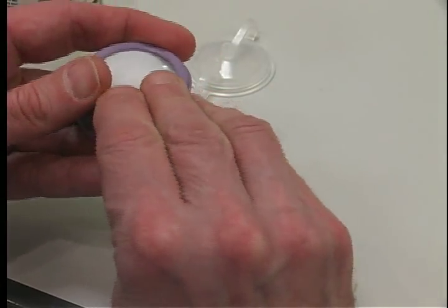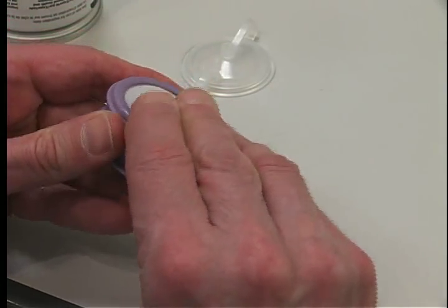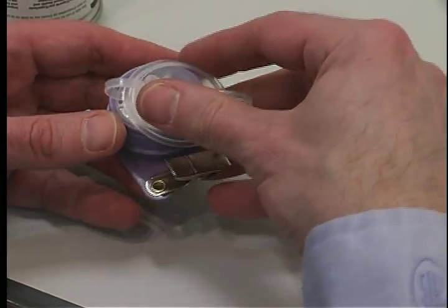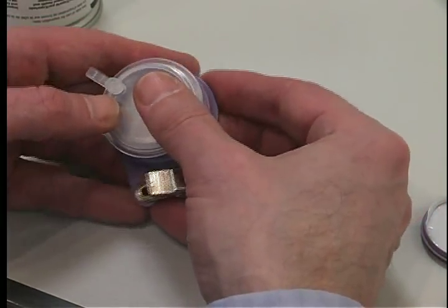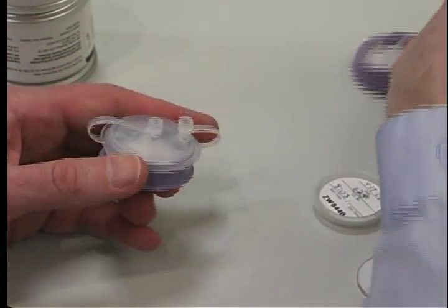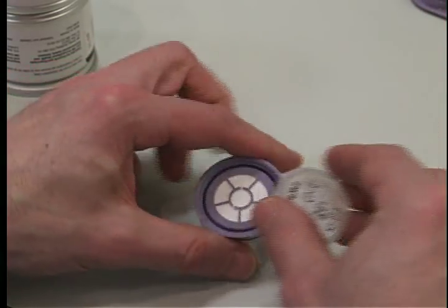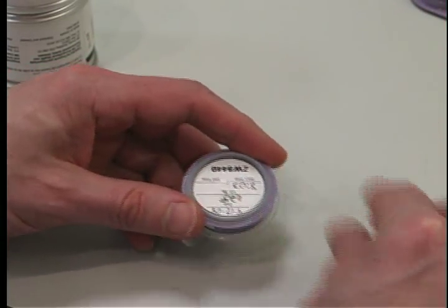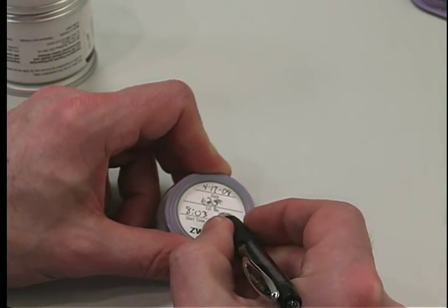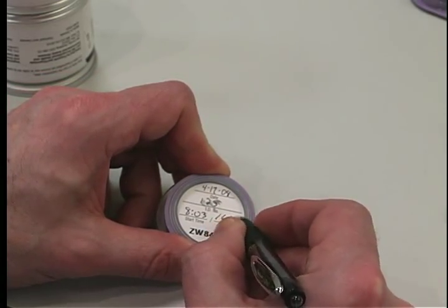After sampling is stopped, remove the plastic ring and white film. Be sure to move immediately to the next step. Snap the cap with plugs onto the top section of the monitor. Separate the top and bottom sections of the monitor and discard the bottom section with the metal clip. Snap the bottom cup with the date, sample ID and starting time on the label into the bottom of the top section. Be sure the cup is snapped securely.